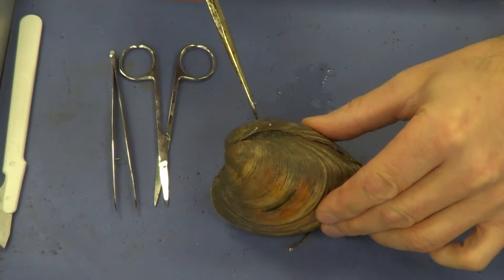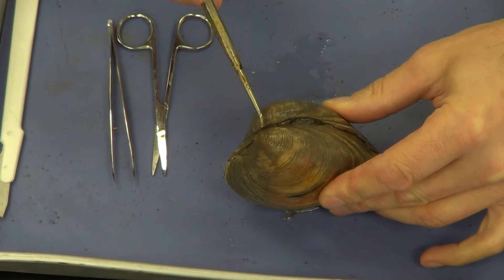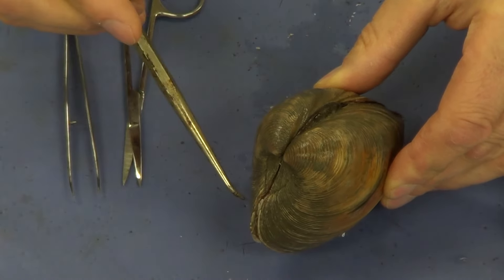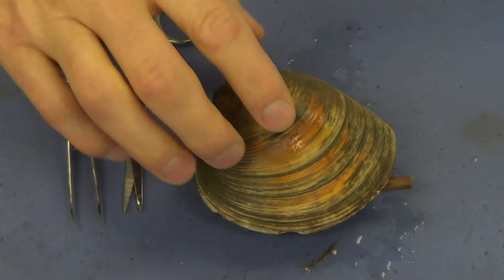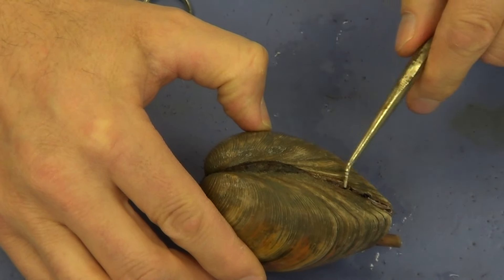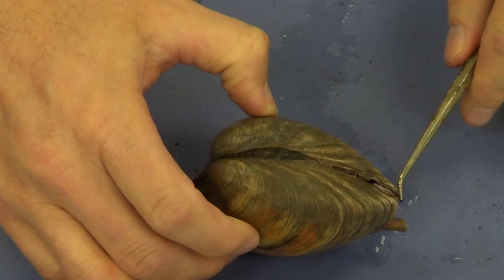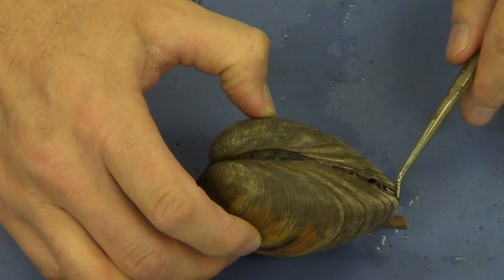If we go back to the hinge again, we see a short side directly adjacent to it. That's going to be the anterior aspect — the headward aspect — because that's where the mouth is going to be located. On the other side of the hinge is a much broader, gentler, longer side. This is going to be the posterior aspect. When we open up this mussel, you're going to see that the anus is on the posterior aspect.